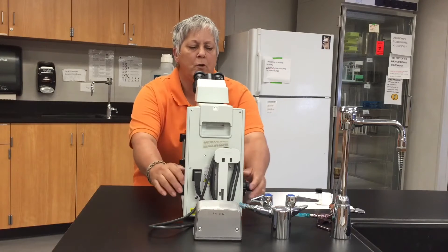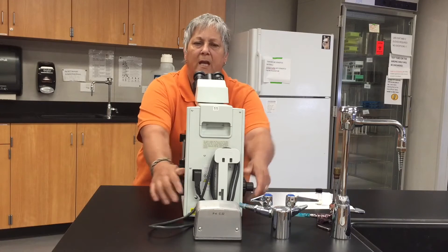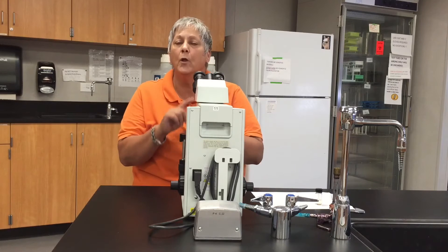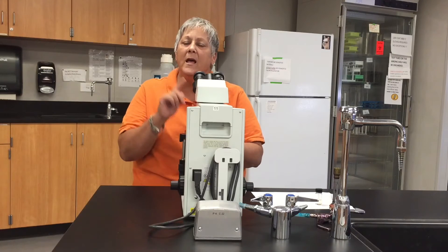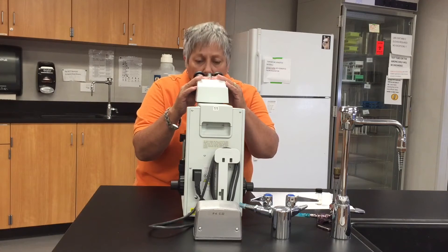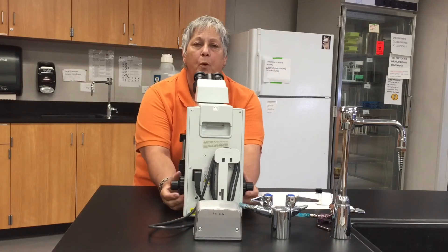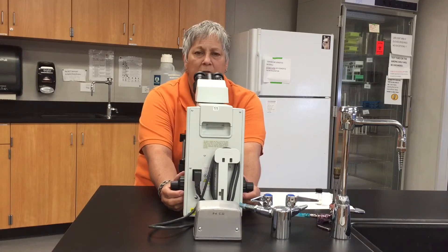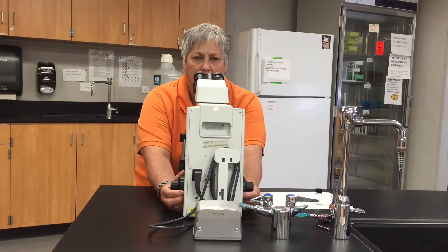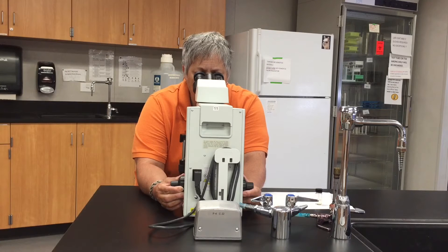Now I'm going to grab hold of the coarse focus adjustment and move the stage up as high as it will go. I want to start with the low power lens in place and the stage in its highest position. Then I look through the ocular lenses, adjust their width so that I see one circle, put my hands back on the coarse focus, and slowly turn it towards me to lower the stage until I find something.